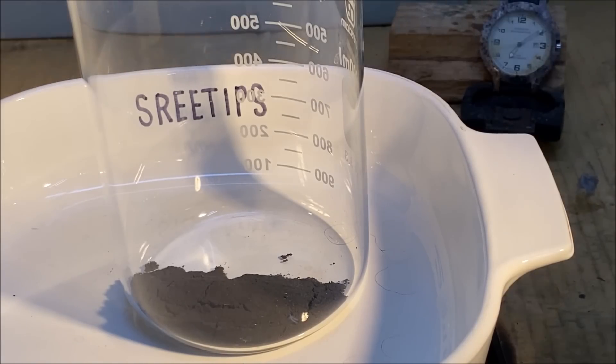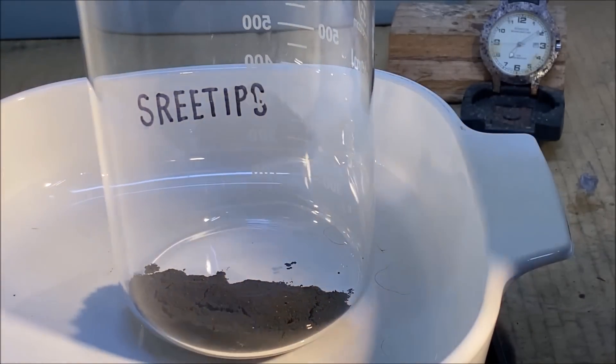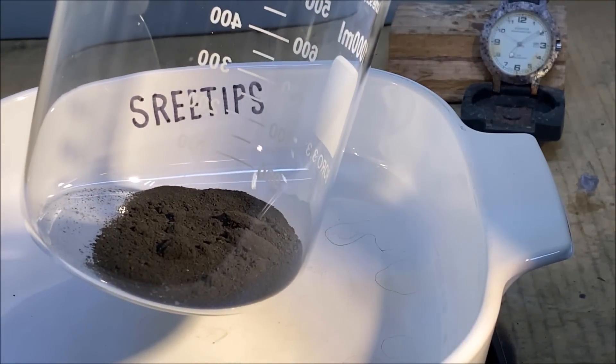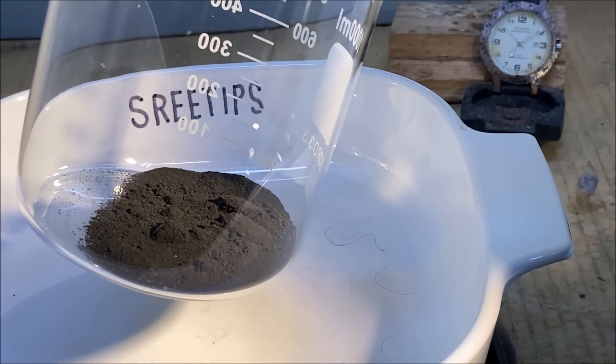Okay, our mixed black PGM powders are bone dry now. Nice and dry, loose. We're going to get a weight on this material now.